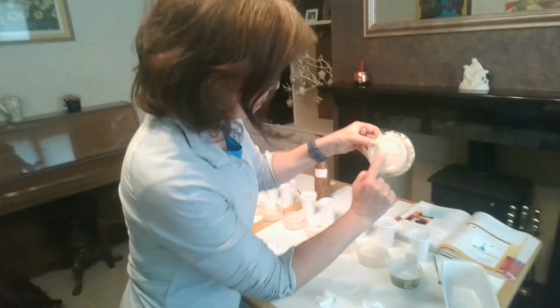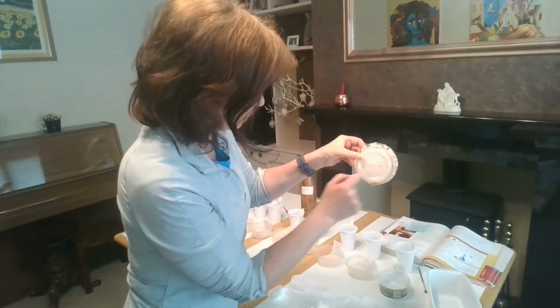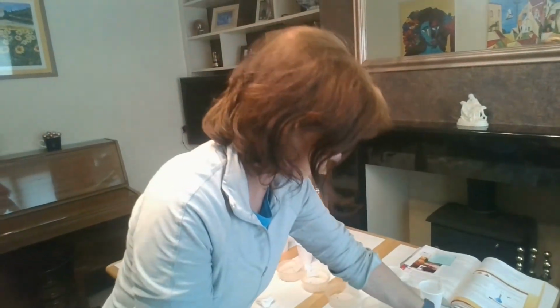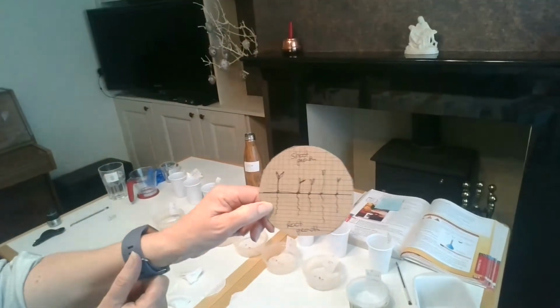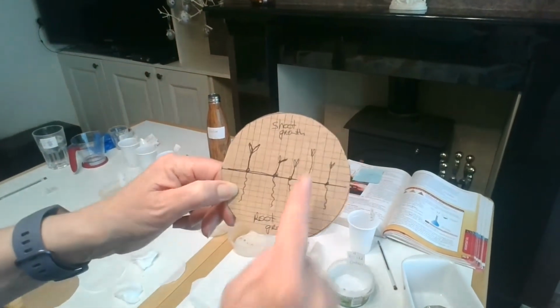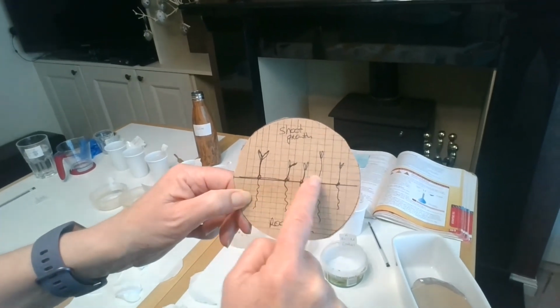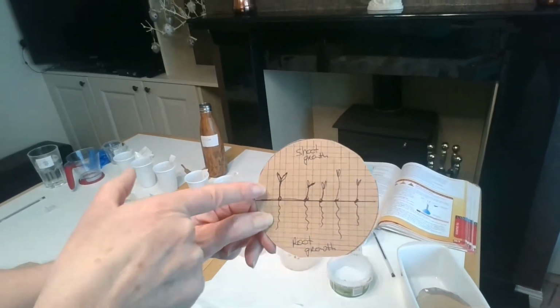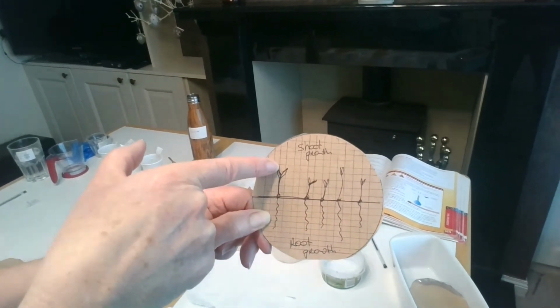Okay, so imagine I'm going to count all the little squares of all the different growth from all of my 8 different Petri dishes. So you'll have to go with me on this one. This is something sort of what it will look like. There is my acetate grid in the background. Here's my 1, 2, 3, 4, 5 seeds. I'm looking at this one and it's grown 5 squares.